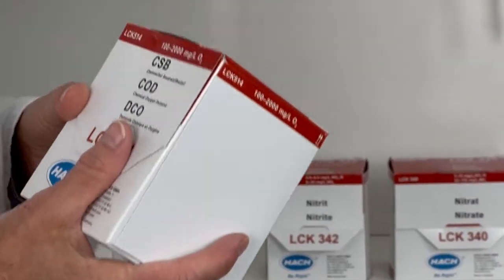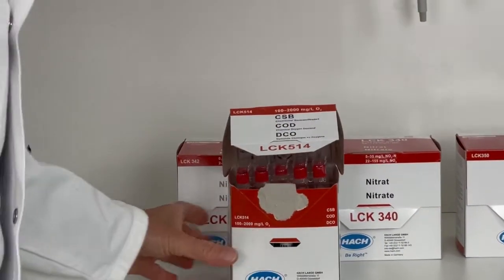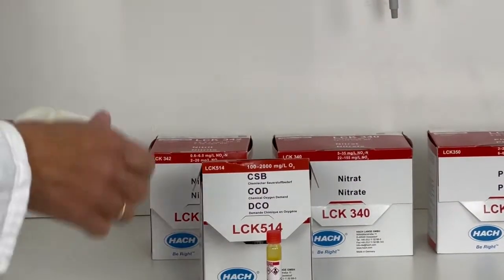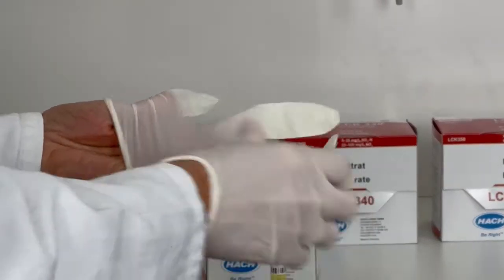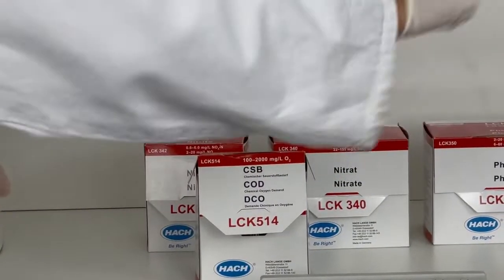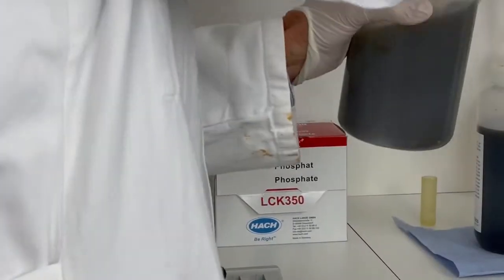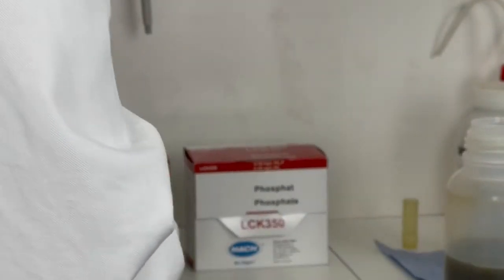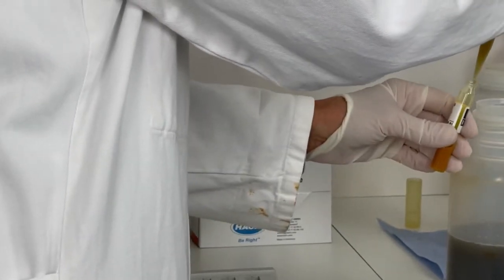Now I would like to show you in detail how to detect the COD. We use cuvettes in a certain range of concentration, and first you have to shake it. I need some gloves, and then you have to add two milliliters of your sample. In this case, it's a sample from a cow stable, which we are analyzing to find out how to treat this kind of wastewater. I take two milliliters of the sample and add it to the cuvette.